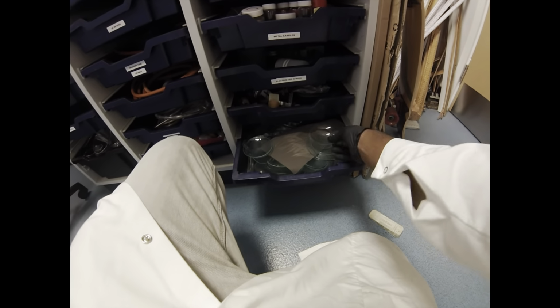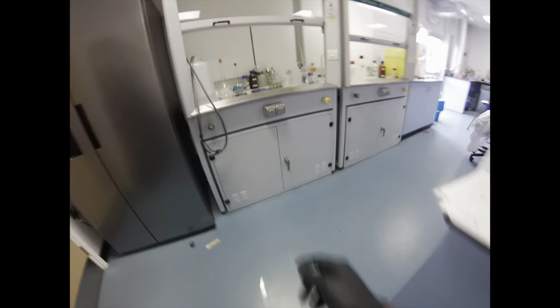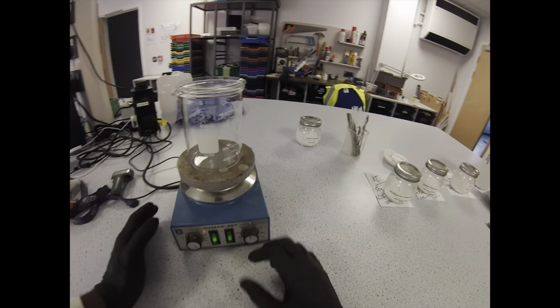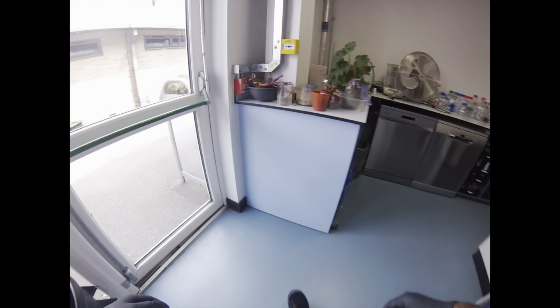So hot plate on, get that nice and hot, nice thick-walled beaker over there, and then we're also going to need a watch glass for the top of that. The watch glass is optional, but it just keeps the heat in, stops evaporation. I've said this before, there's loads of different ways of making starch solution, but this is the way that I was taught. Heat-proof mat, so I'm prepared for when I want to take it off the heat.